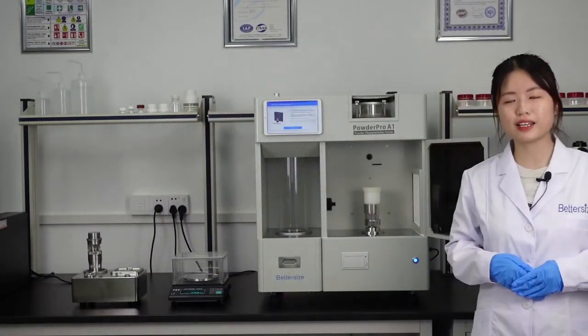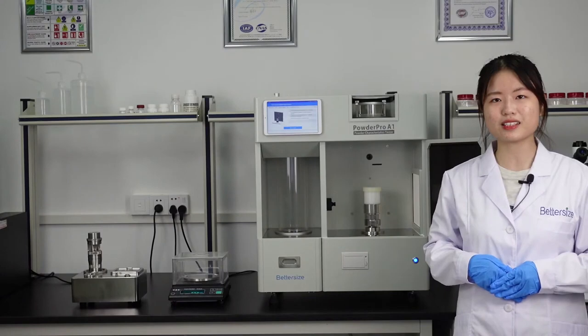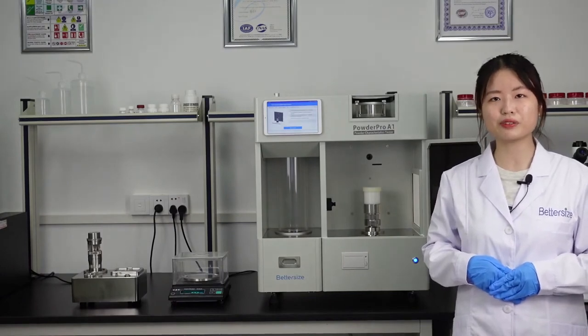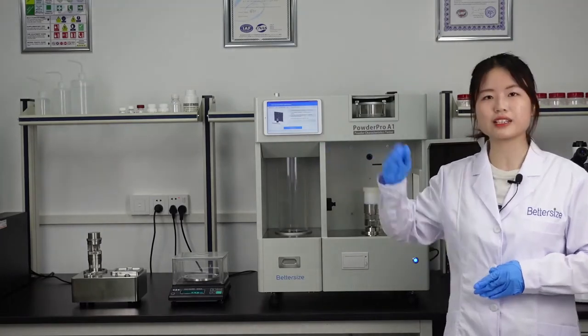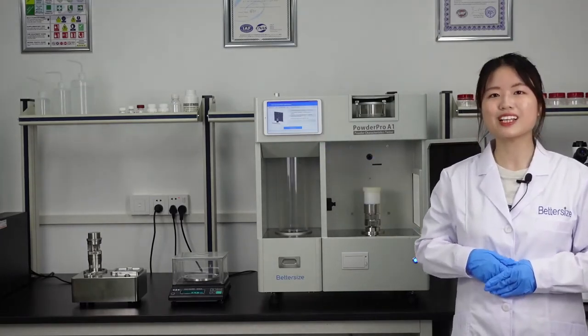Moreover, after obtaining the bulk density and tap density of a given powder material, the compressibility will be automatically calculated by the PowderTester app. Okay, let's go!